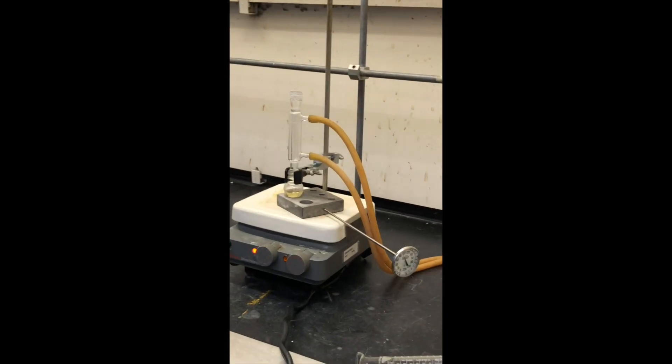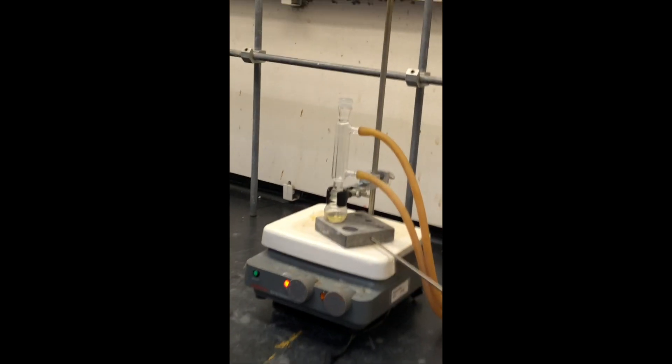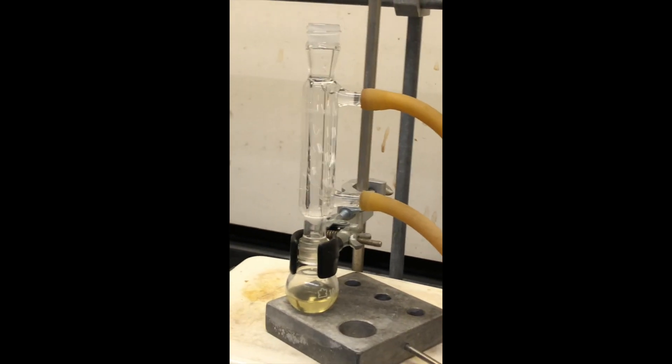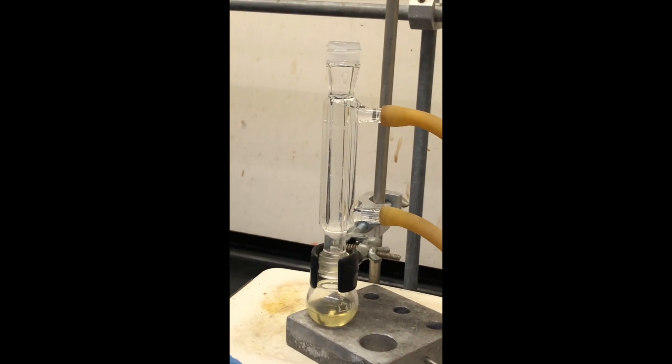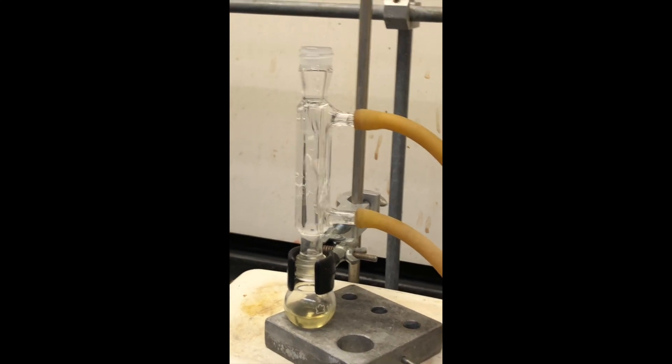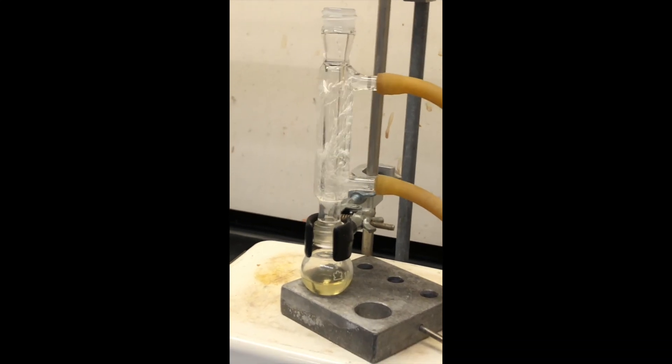We're going to then wait for this to come to a boil so we can start our reflux period and we will pick up the video once the reflux has begun.